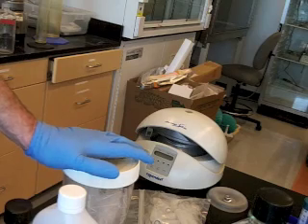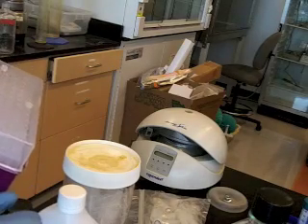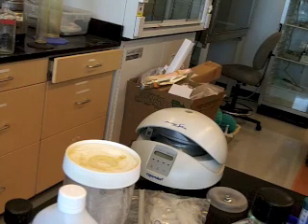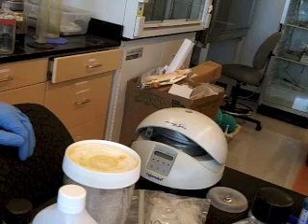And then the next rule is that we would just keep things covered. So we'd open this up to get a tip, but then we're just going to cover it up. That's going to minimize that dust, that contamination that could destroy our samples. And so that's the first habit of cell and molecular biology micropipetting, is that everything stays covered. We want to keep it clean.